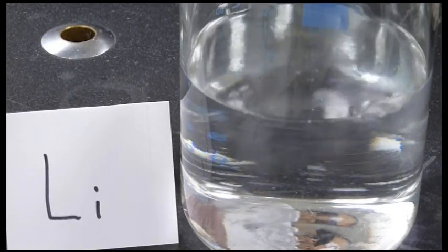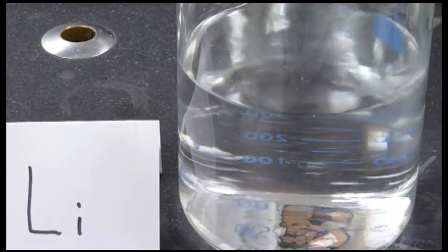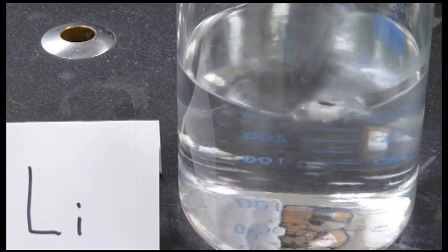What you can see is some bubbling. See that it's reacting with the water. The gas bubbles that are forming are hydrogen gas.